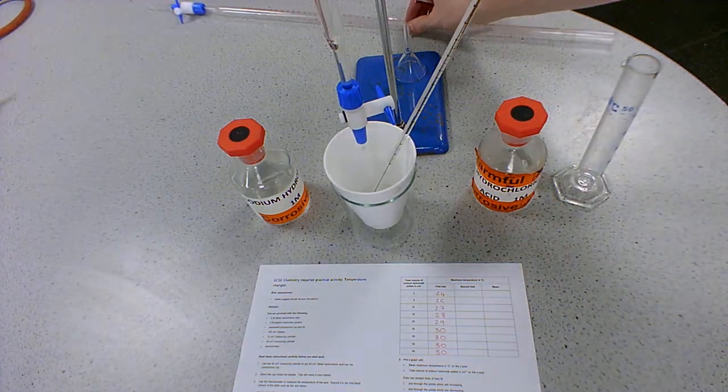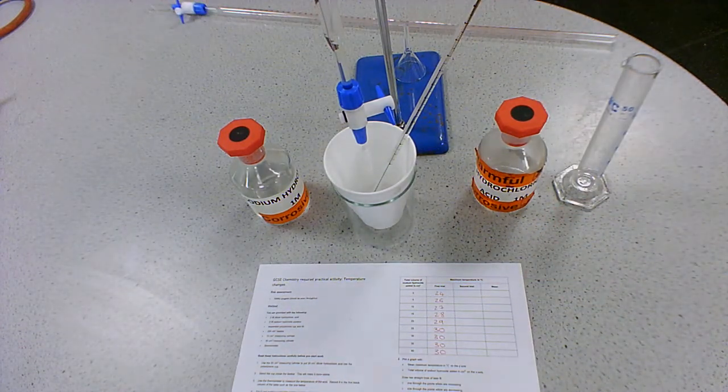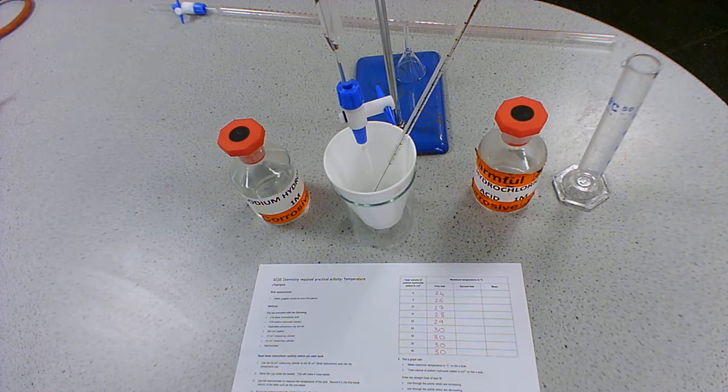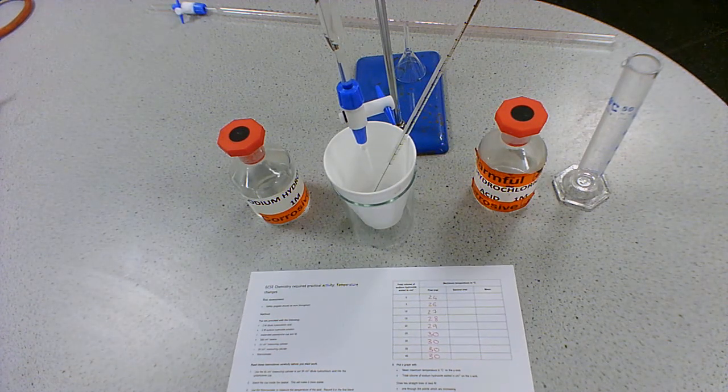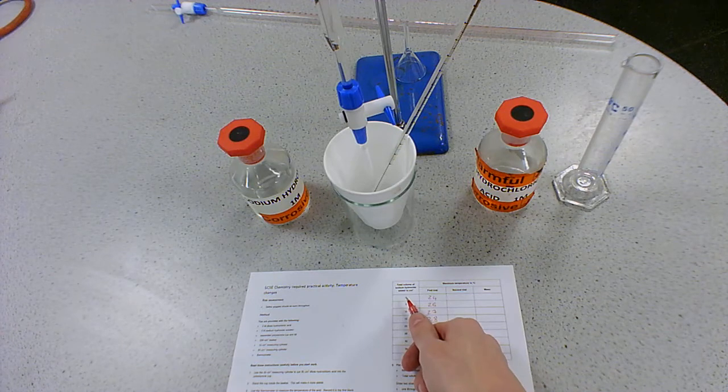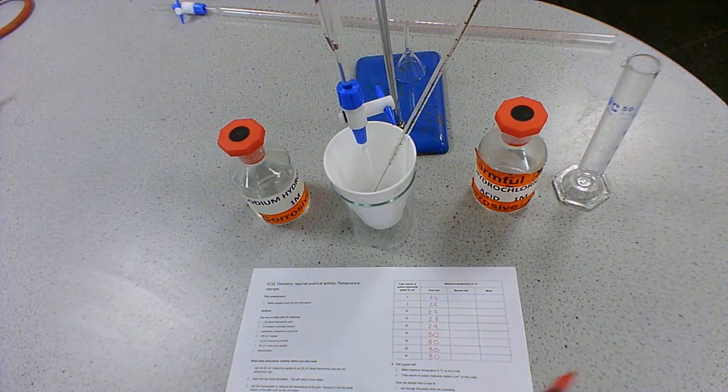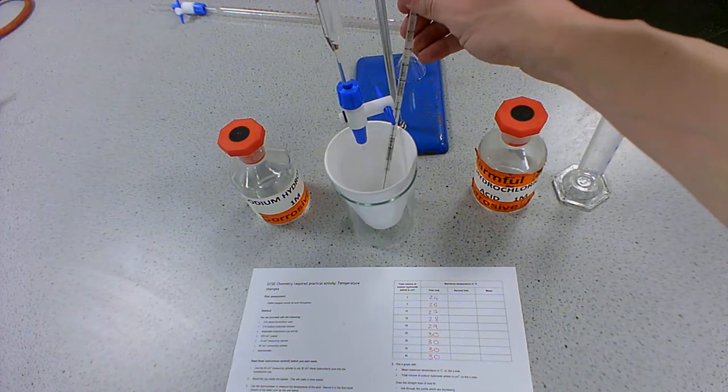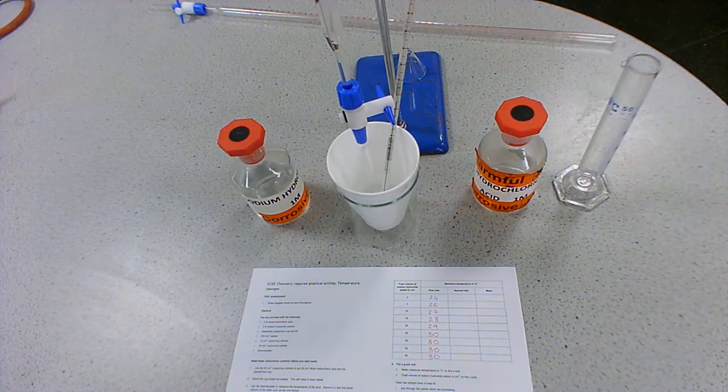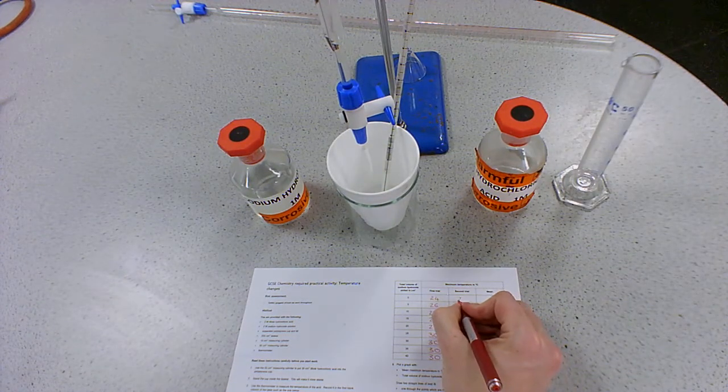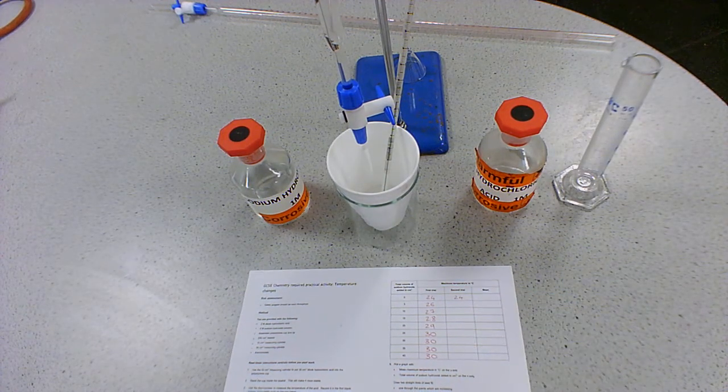Now, you'll see that I've already carried out the first trial, so I'm just going to film going through the second trial. So we need our temperature when zero has been added, so that's our start temperature. So we'll just grab that now quickly. That's going to be 24 degrees. Surprise, surprise, it hasn't changed since I did this five minutes ago.